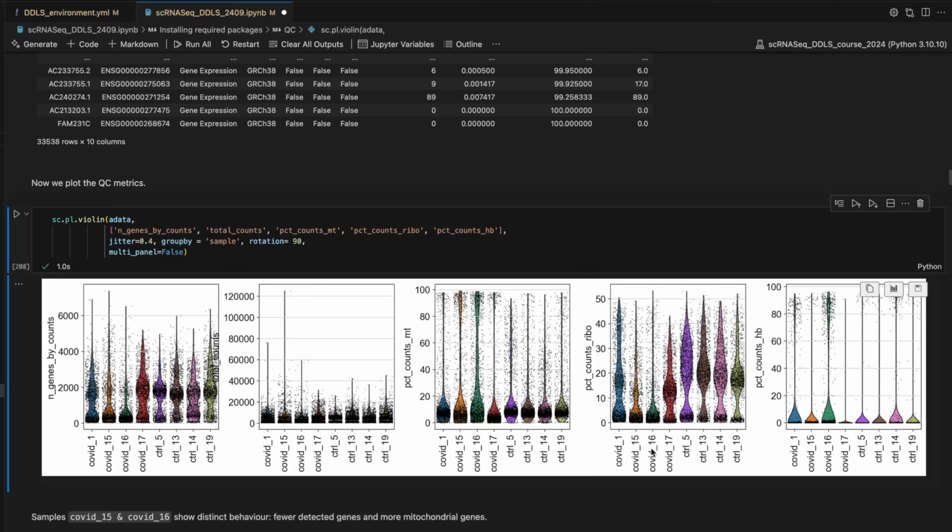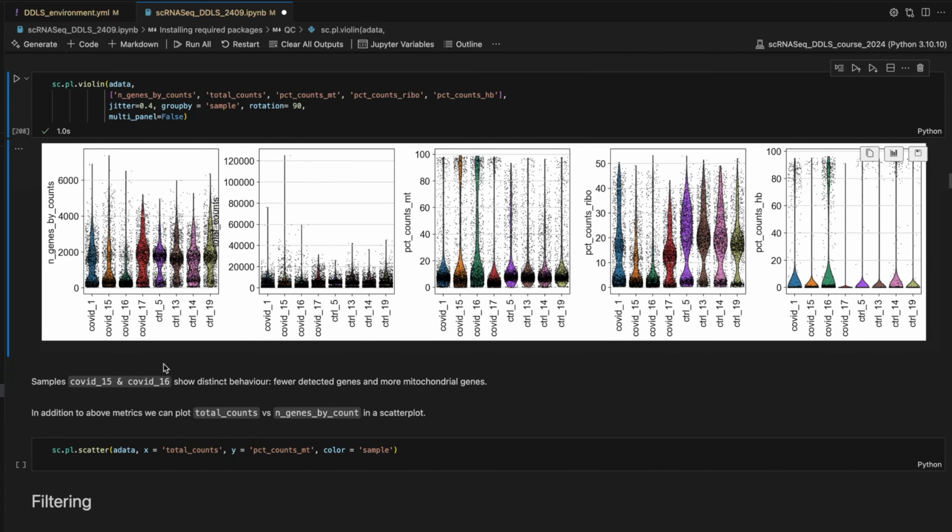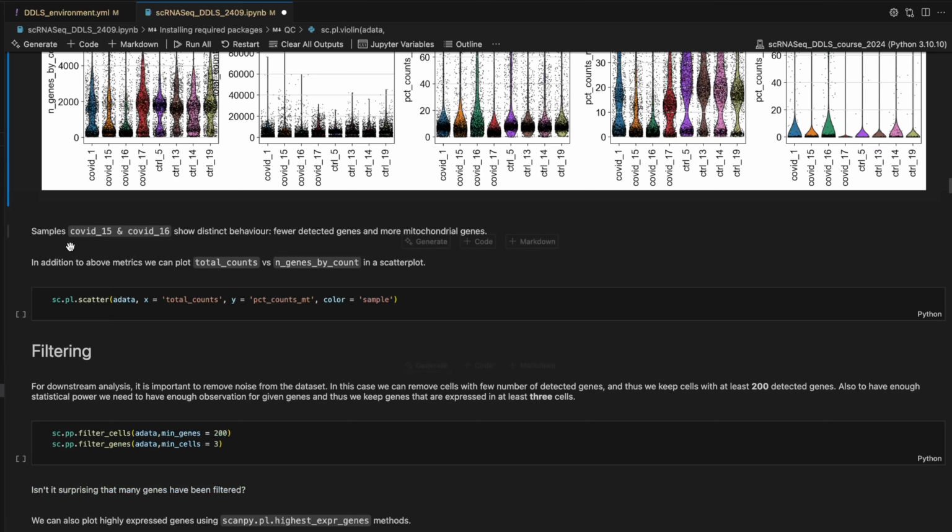Anyway, now the ribosomal looks okay-ish. We have mostly, this looks okay. If you want to be picky, you can talk about the differences in the distribution. But for now, I think we are good, and we have a low percentage of hemoglobin, but we are going to filter these genes as we move on. So it's nothing to be worried about here at this stage. As I told you, COVID 15 and 16 behave a bit differently.